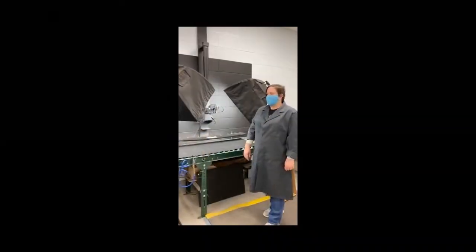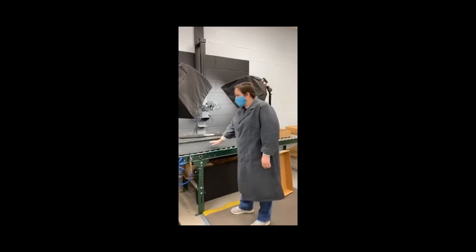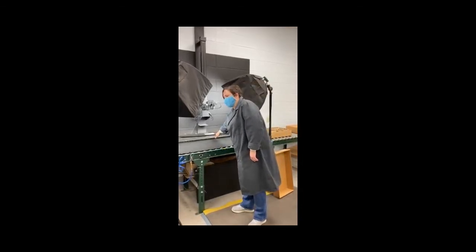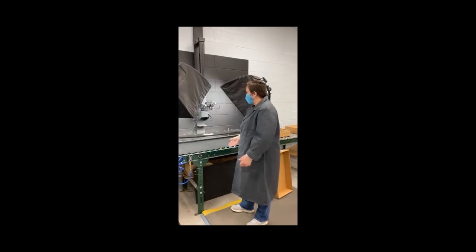Core photography starts with studio setup. We have fixed lighting, black background, and an adjustable shelf with a color card and ruler. The camera is set directly above and is height adjustable.